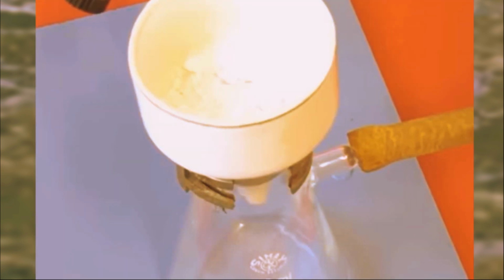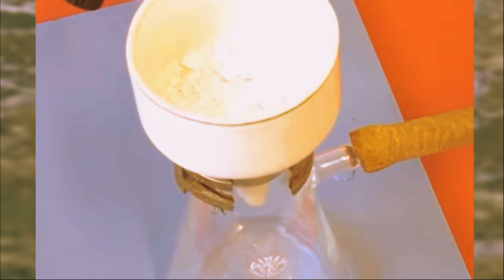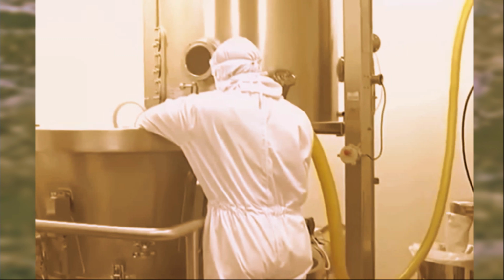Every tablet or capsule has to be top quality, so throughout the production process, scientists take little aspirin samples at different stages. They test these samples to measure the exact concentration of aspirin in each one.